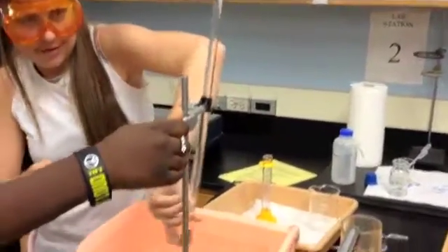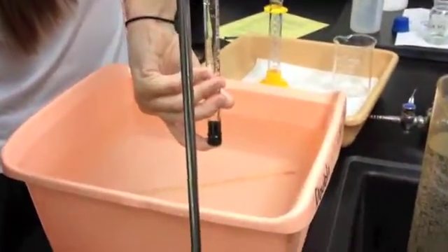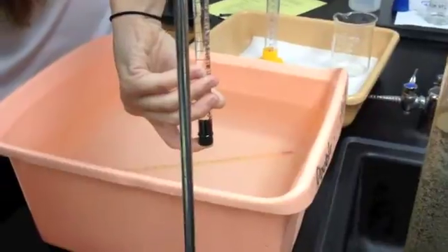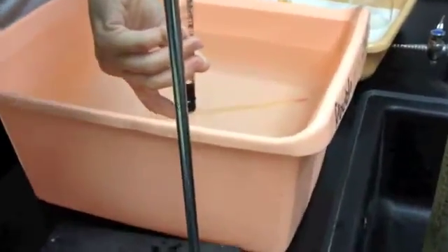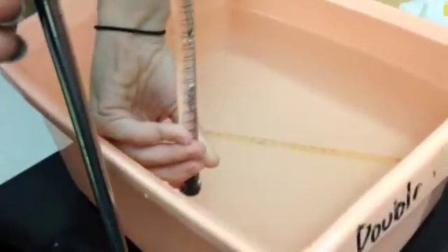Ooh! Down, down. Good. Into the water. Alright, stop. Tighten it.